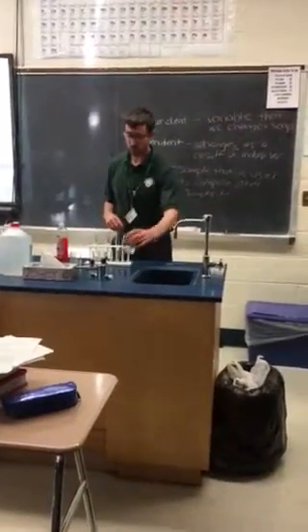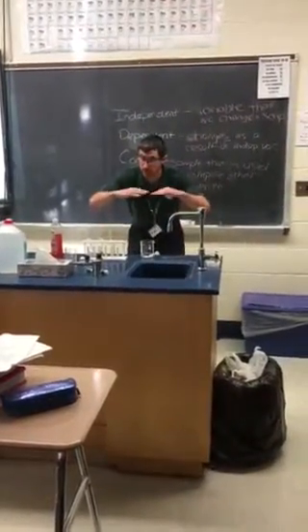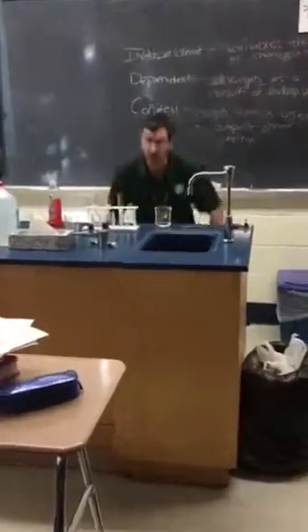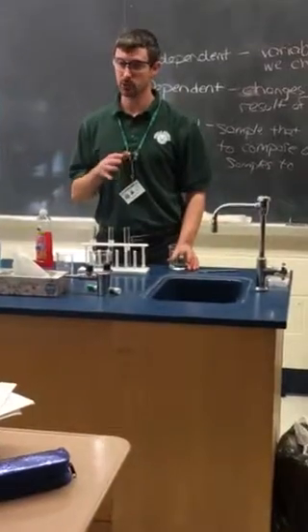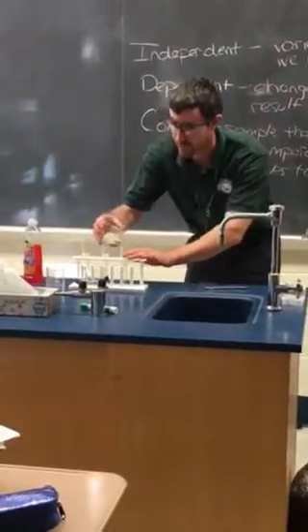Okay, so you're gonna pour, and we remember how to read eye level, right? We come down to the level of the beaker where we see the water intersecting the lines. This is right at 50 milliliters, so we're gonna pour 20 milliliters into each tube. It doesn't have to be exact as long as they're about the same level, but just so you have an idea, it's about 20.